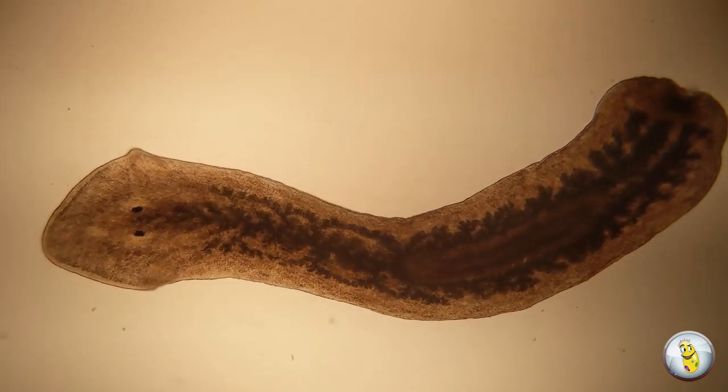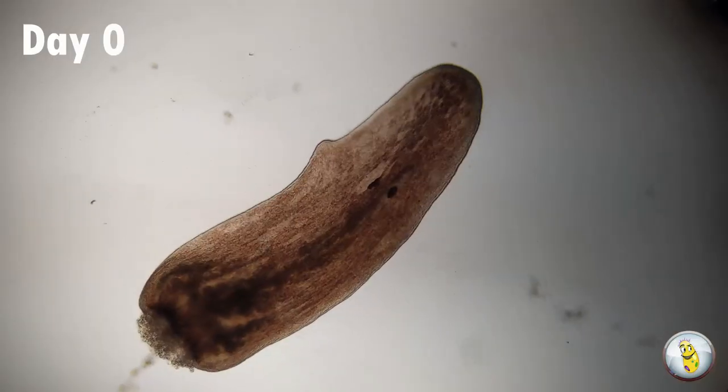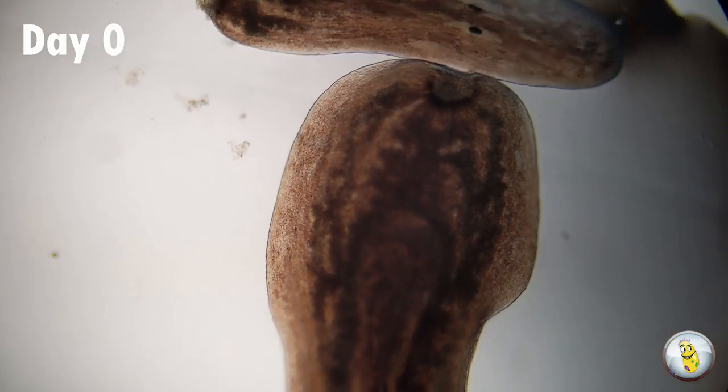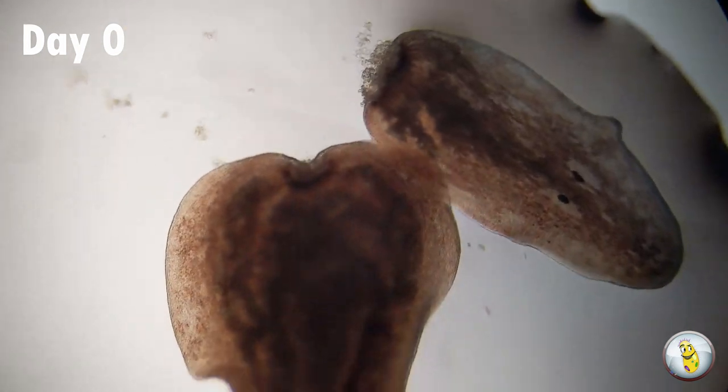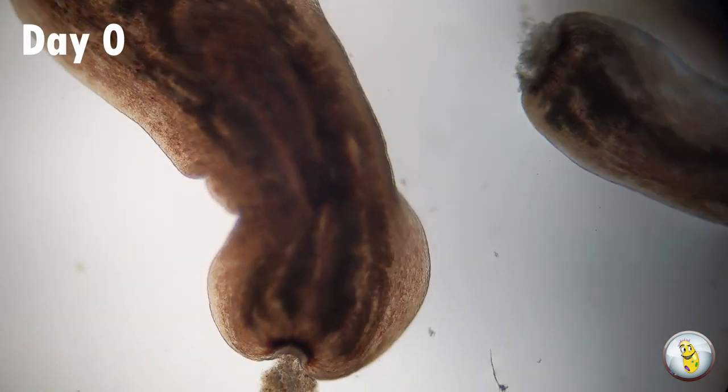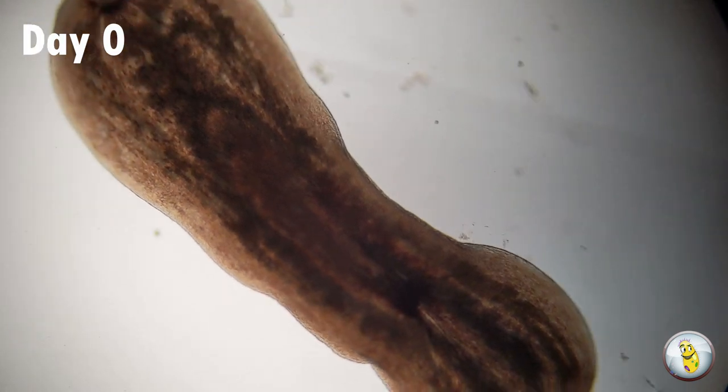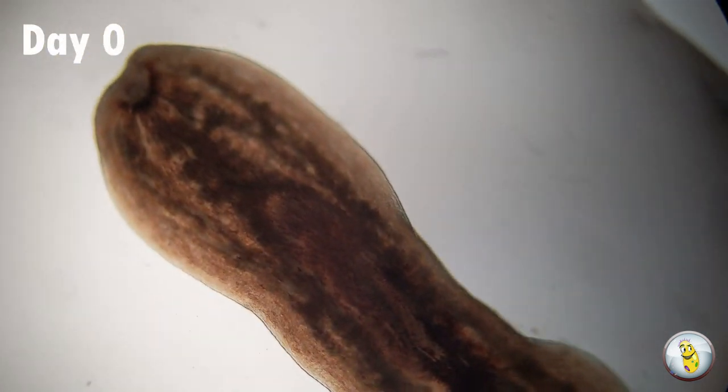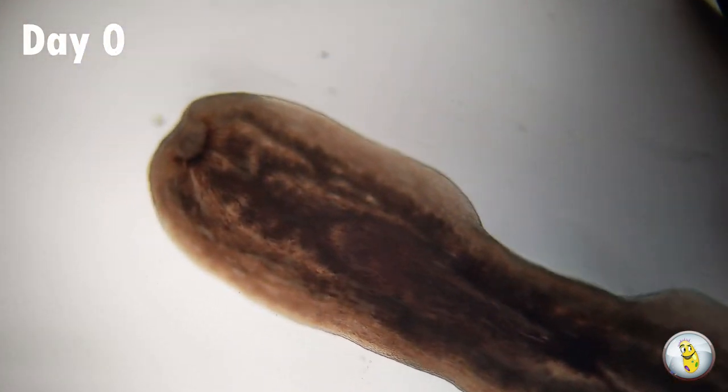Are you ready to see it? Let's do this. Okay, here we are on day zero, bisection day. Here we see the head, and the head is swimming by this larger part. That's the middle part. And you can see that some of the insides are sort of hanging out, but the parts are moving around pretty much like normal.